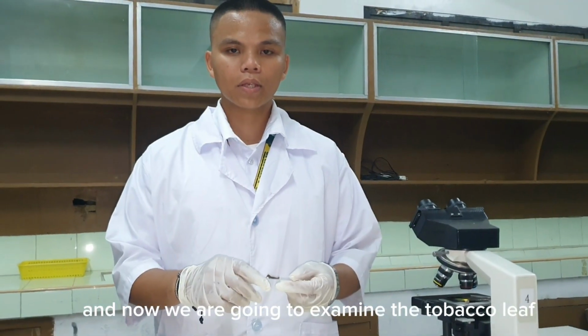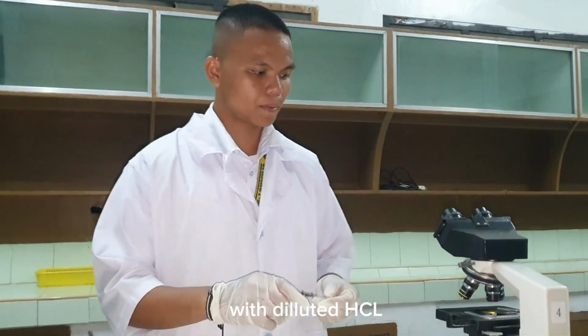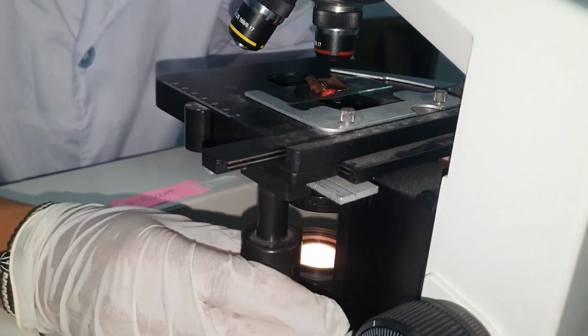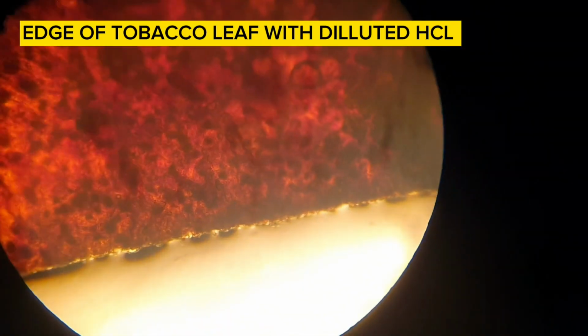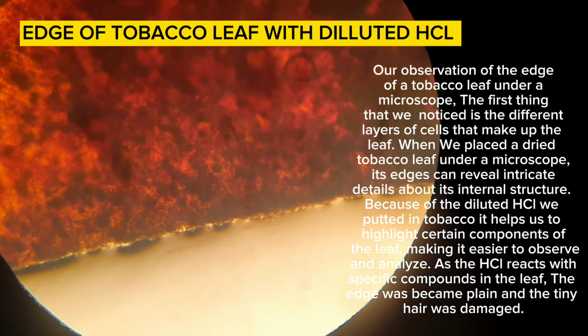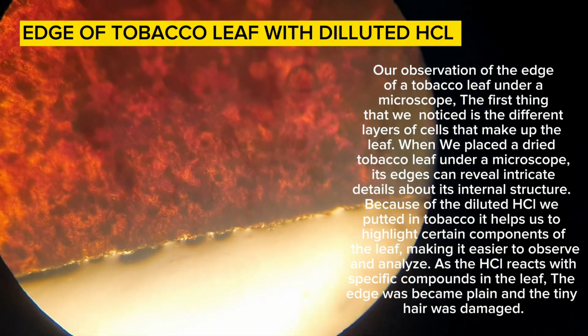Now we're going to examine the tobacco leaf with diluted HCl. Our observation of the edge of a tobacco leaf under a microscope: the first thing that we notice is the different layers of cells that make up the leaf.